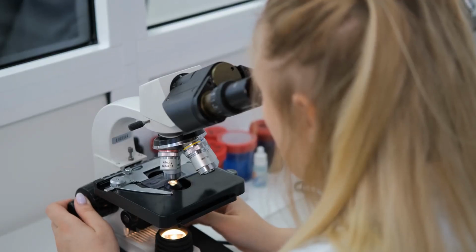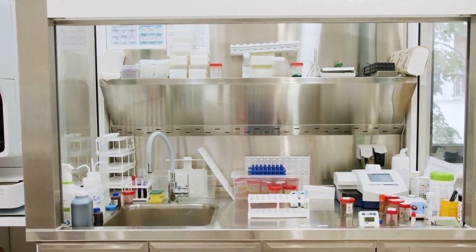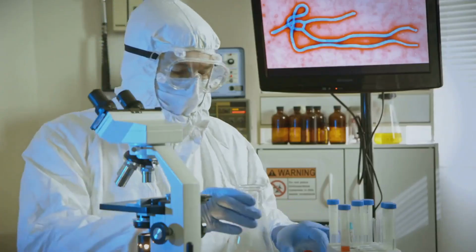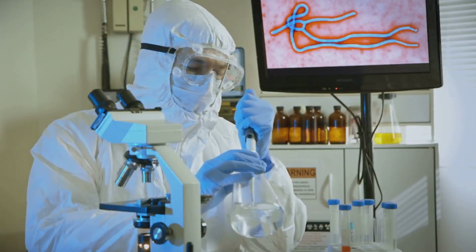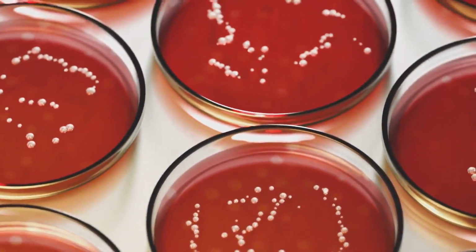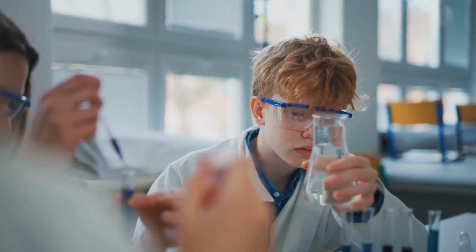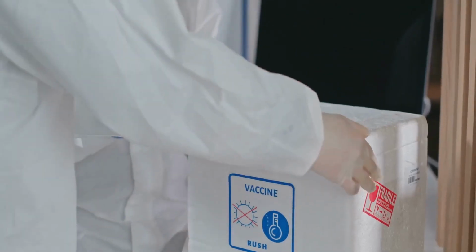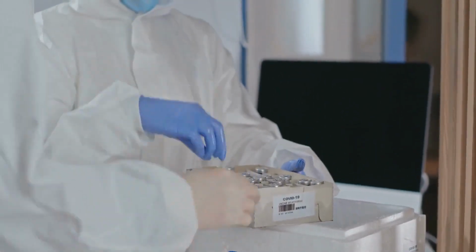Microscopy alone will not allow us to identify a microbe to the species level. In this section of your laboratory, you will be introduced to a survey of biochemical tests and selective and differential media used by laboratory professionals to identify microorganisms to their species levels. You will explore a variety of tests, such as the triple sugar iron agar test, catalase test, blood agar, mannitol salt agar, among others. These tests can often prove challenging to understand when first encountered, and therefore often frustrate students. So, let's take a moment to see why an understanding of these tests will help you in your future career as an allied healthcare professional.